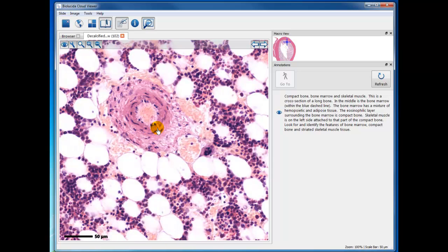Now, in the center here, this is something you haven't studied yet. This is a cross-section of an arteriole within the bone marrow, and surrounding that you have some sinusoid vessels with red blood cells in it, and these little tiny cells here are lymphocytes within the blood vessel. This is smooth muscle. You are studying smooth muscle during this second module, and the smooth muscle is arranged around the lumen of the arteriole, and lining the lumen is simple squamous epithelium, and we know that as endothelium. And out around here would be adventitia. Now those are the endothelium and the smooth muscle in the media and adventitia. That's something you will learn, those terms and those parts of the vessel, when you study the cardiovascular system in Module 3. So I'm going to pause this for a moment.